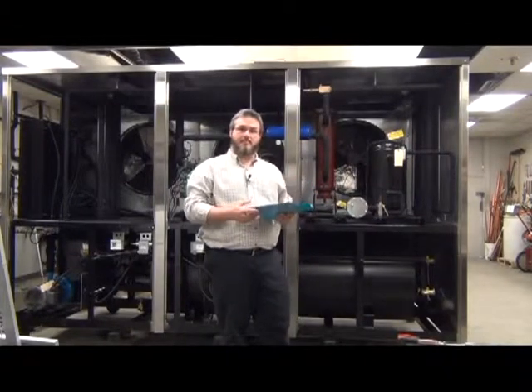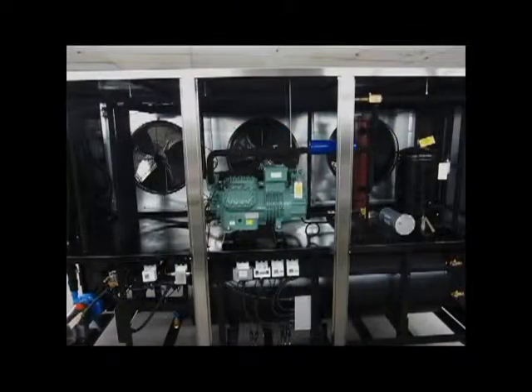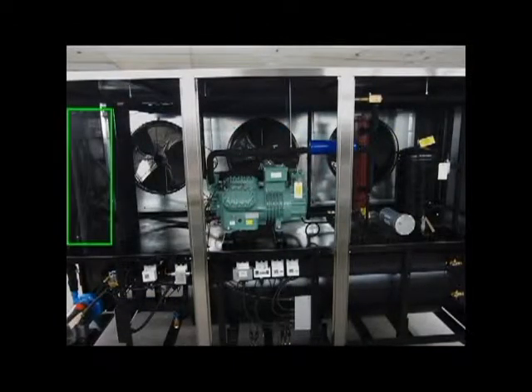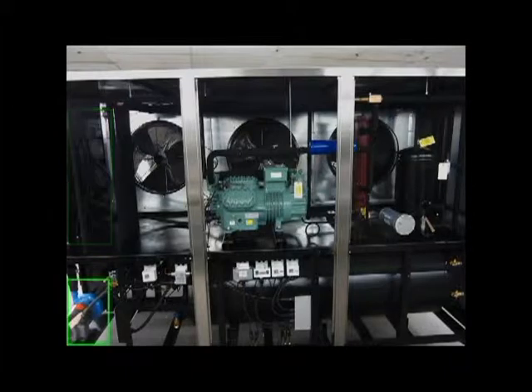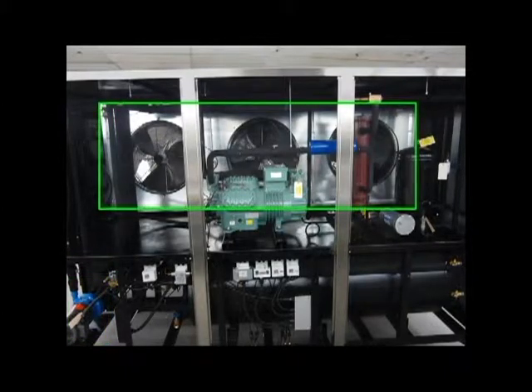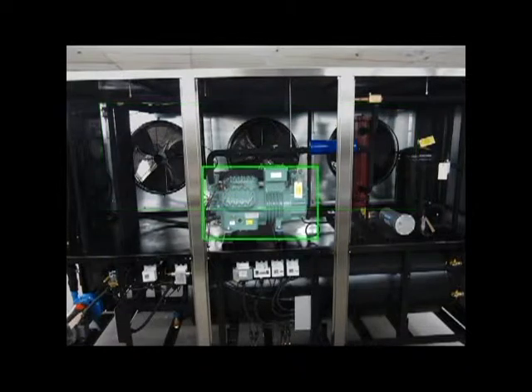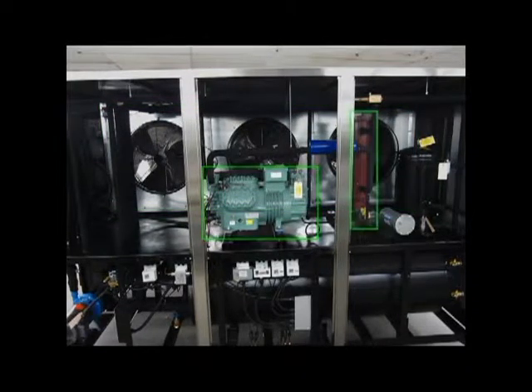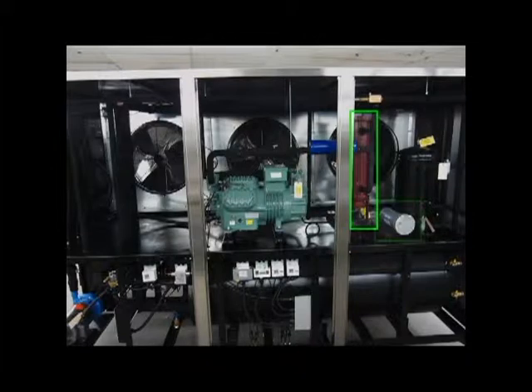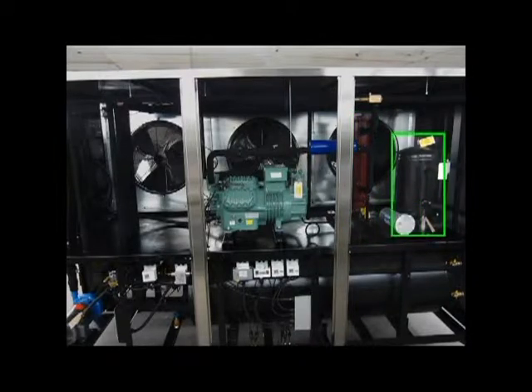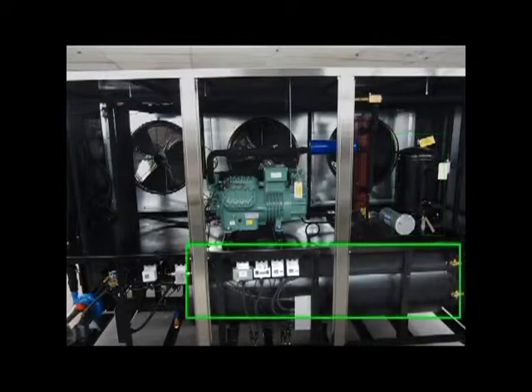To review the main components inside the chiller cabinet, you have your electrical box, panel, and connections, including plumbing connections at this end. The recirculating pump, the condenser, the compressor, the oil separator, liquid line dryer, receiver, and finally the immersion coil evaporator and tank.